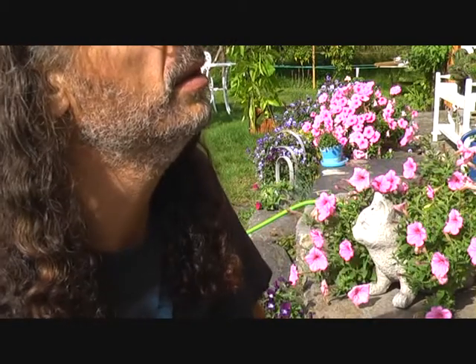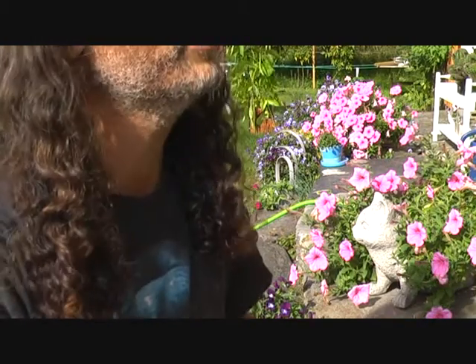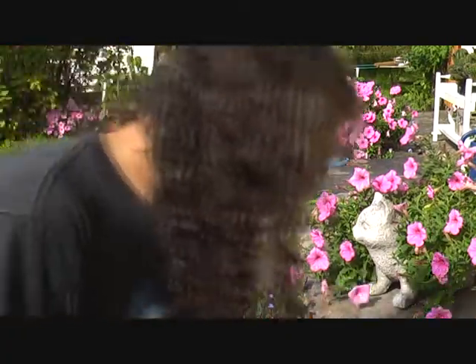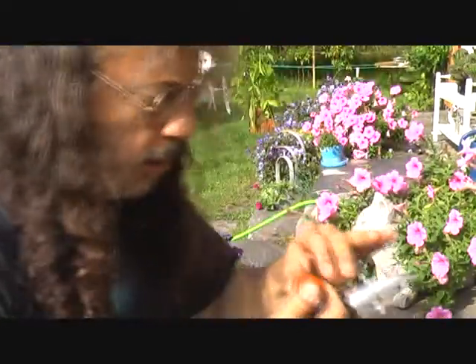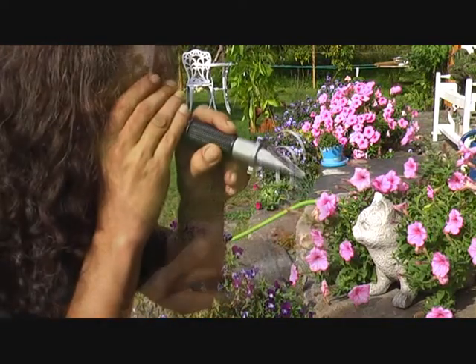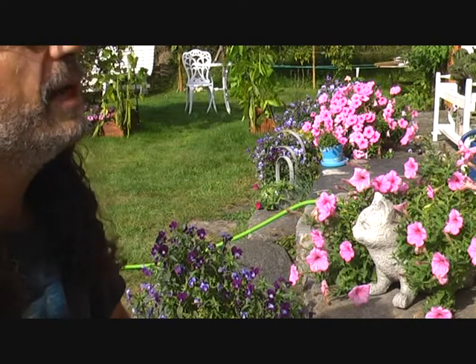7.2. So the Brix value can vary a lot between different plants in the same variety. I'll do a control measure — here's another one. I'll test this one as well. Okay, this one was 8.1.